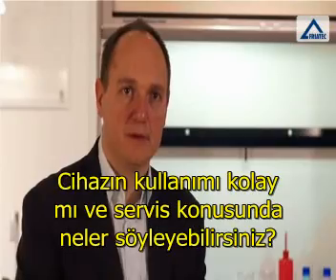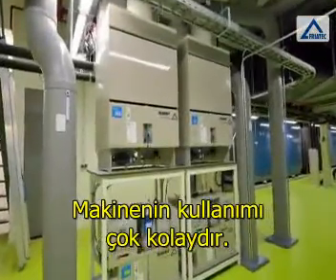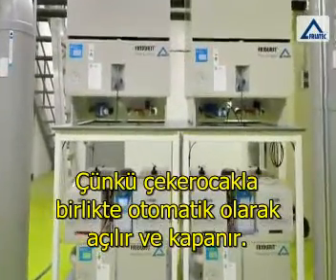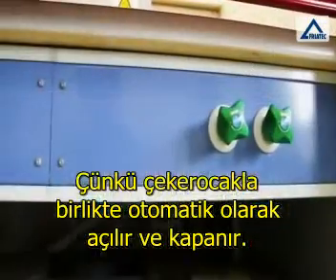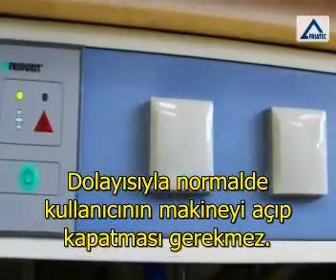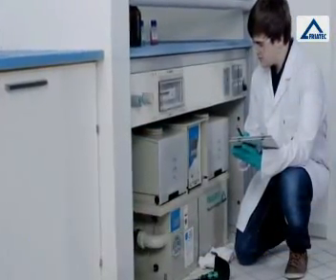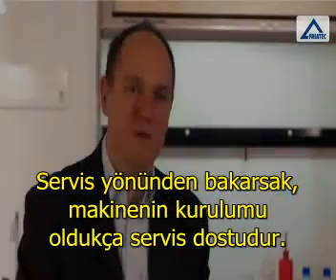Is it easy to handle, and what does it look like if we talk about servicing? The handling of the machine is very easy because it switches on and off automatically in combination with the fume hood. So normally the user doesn't have to switch the machine on or off. It's doing it itself.